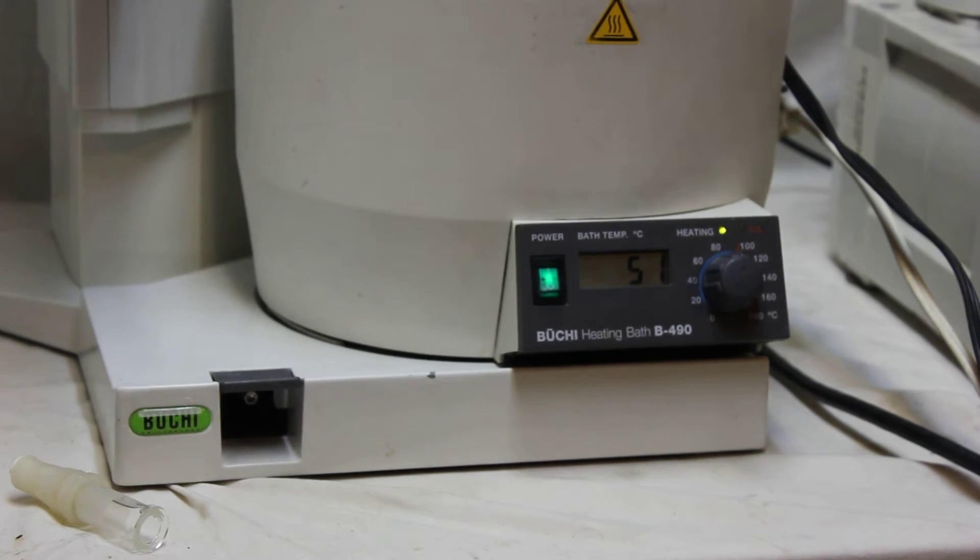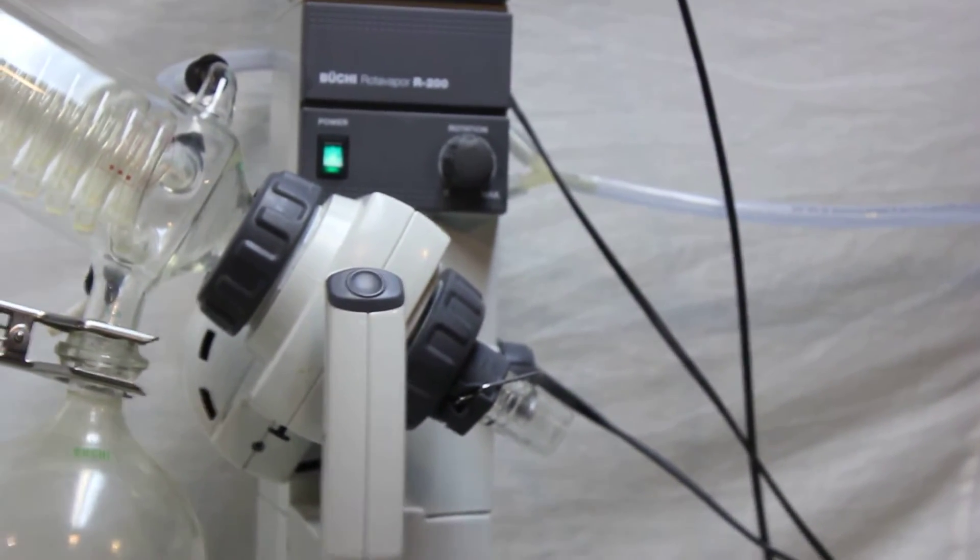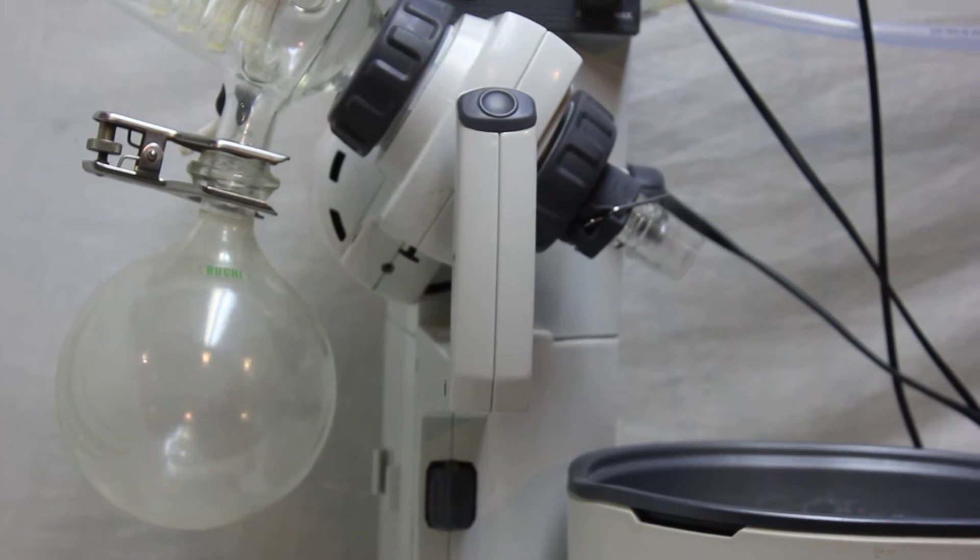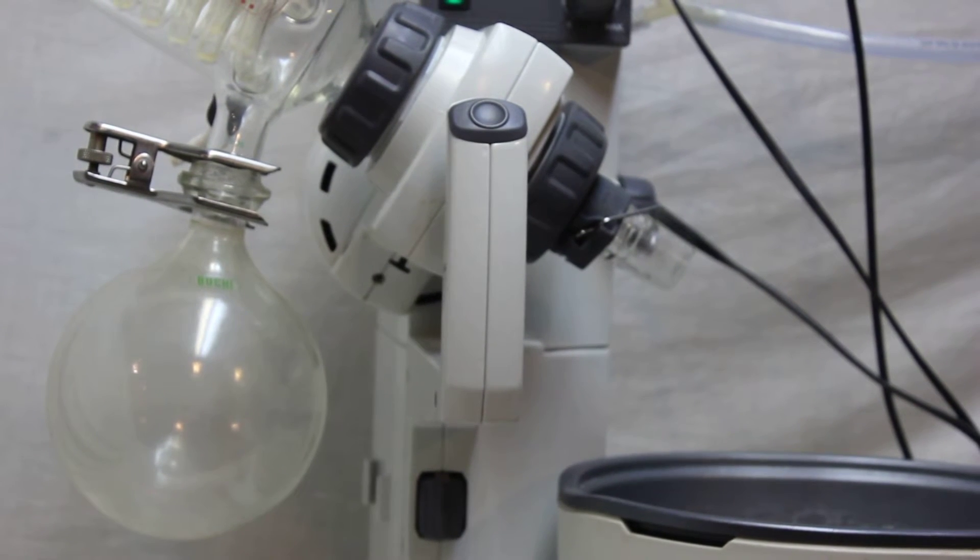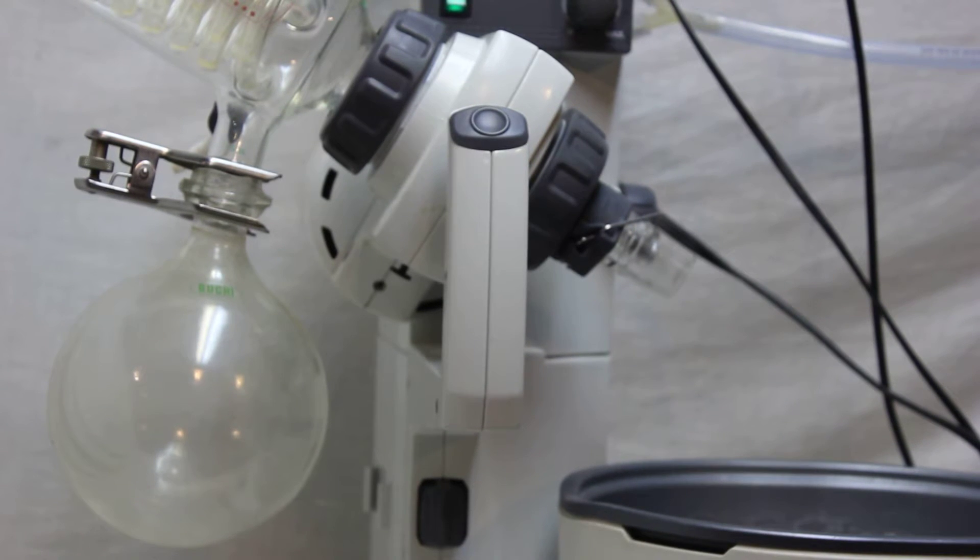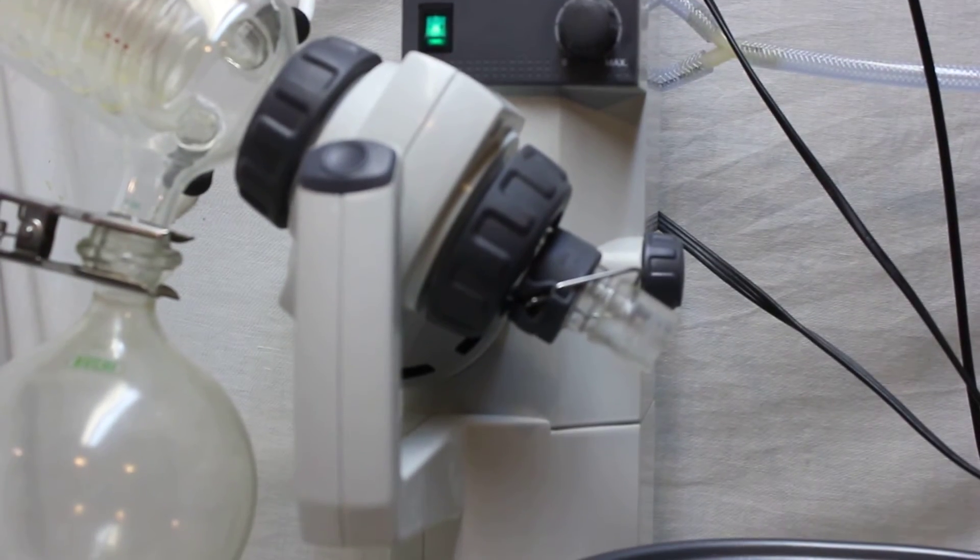At first, we just wanted to test if this lab equipment is working smoothly, gently, and just very good. So let's just close a little.